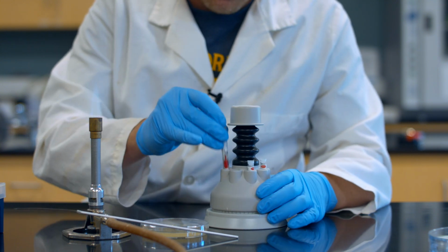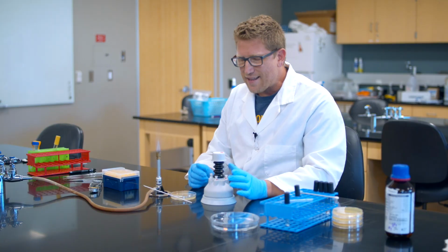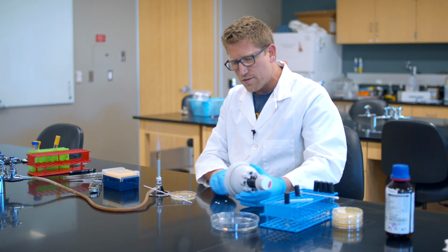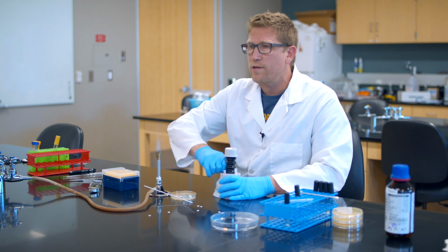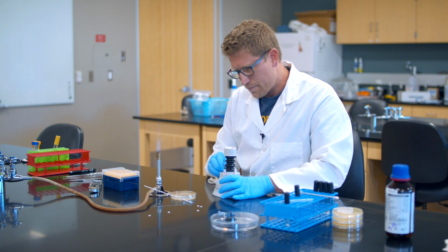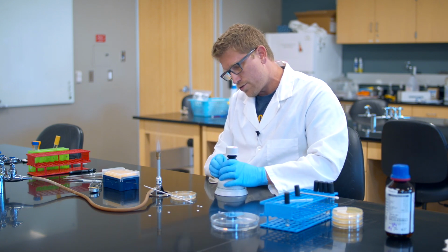And then our last one right here. This one doesn't want to go in. Hopefully that went in all the way. We'll find out. I like to do a test run with this to make sure everything's fitting. So I hit it once and I check. Oops, see, only 3 antibiotics came out. And there's still just 3. I bet it's this last one that wasn't going in quite straight. I'm going to pull this one out. I can feel it. It should just pop right out, and so it didn't go in straight this time.